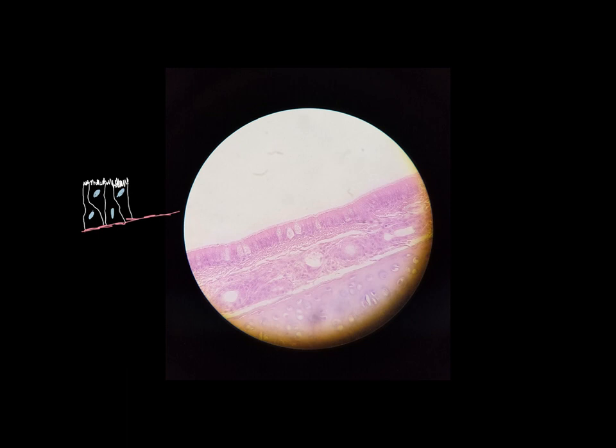All of the cells rest on this same area right here. This is called the basement membrane. Every cell there sits on that basement membrane. Some of them are a little wide at the bottom and narrow at the top, and its neighbor may be wider at the top and narrow at the bottom. So it kind of looks like there's two layers or more there, but if you really look closely, they all sit on this same basement membrane, so it's only one layer thick. It's falsely stratified, pseudo-stratified.